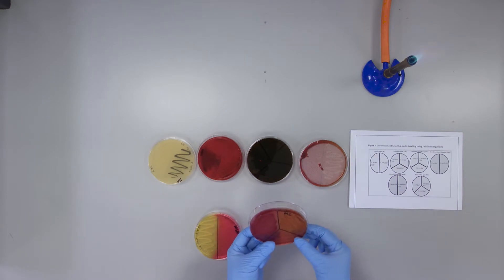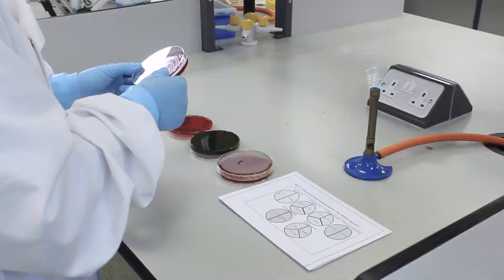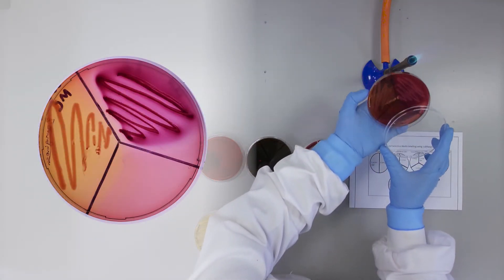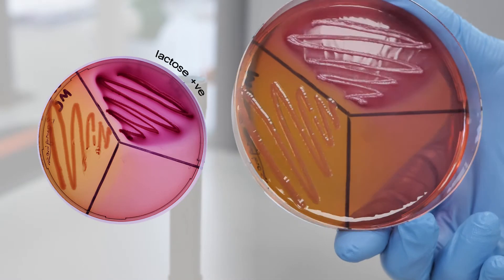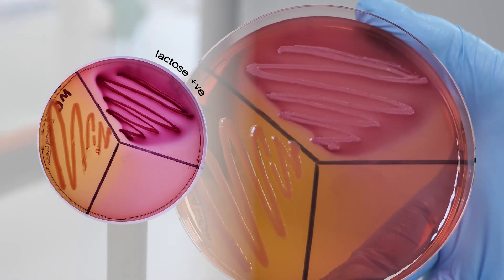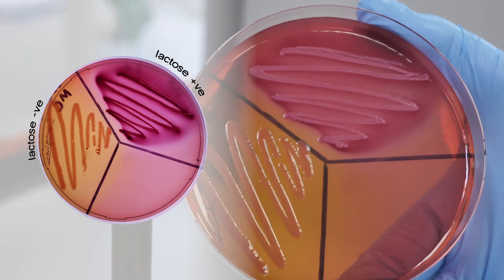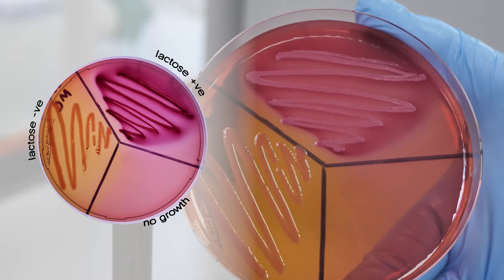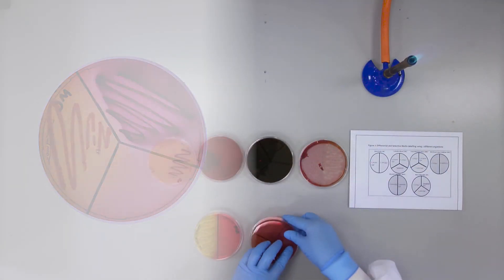MacConkey agar is selective because only bile salt tolerant gram negative bacteria can be grown on the medium. Lactose positive organisms appear as dark red or fuchsia colonies on the agar plate. Lactose negative growth is colourless. If an inoculated culture does not grow, then it can be concluded that it is gram positive.